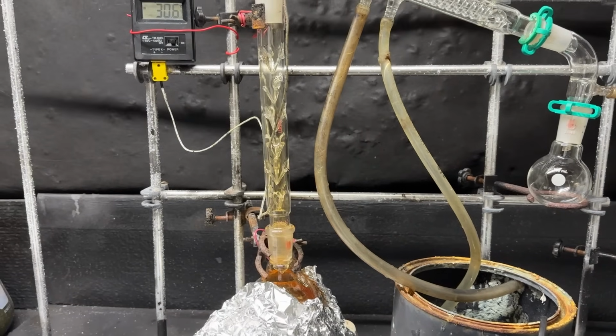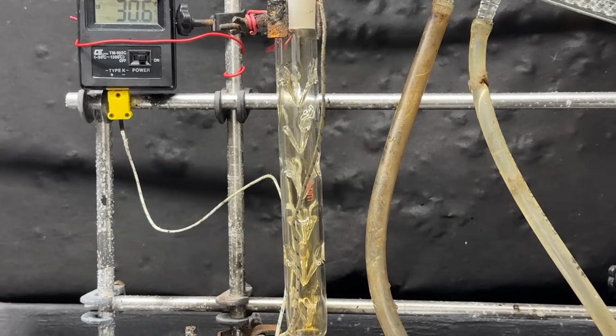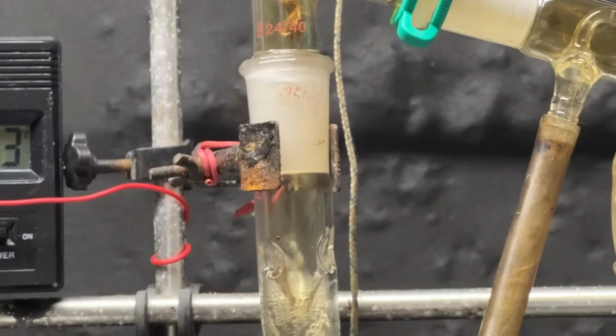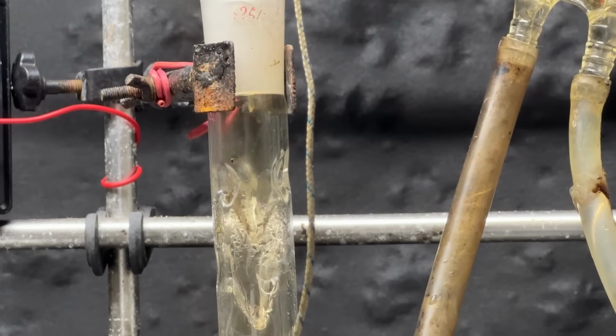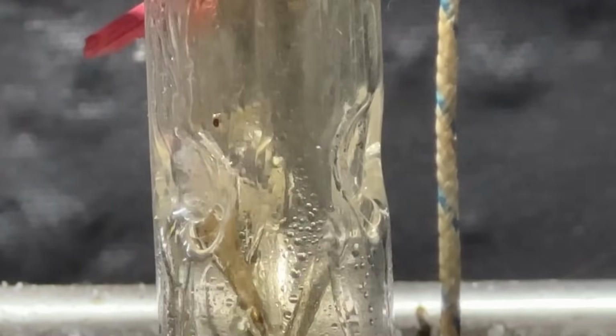Okay, we're starting to get a boil, and looks like some nitrogen dioxide's coming out of solution and entering the rest of the distillation. But that's okay. That will all eventually disappear and out that tube there. Yeah, as you may be able to see, it's almost climbed its way to the top. It's climbing the column right now, and it's almost there. So that should be our toluene.